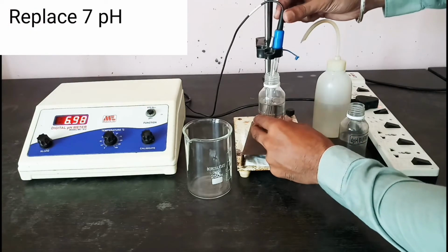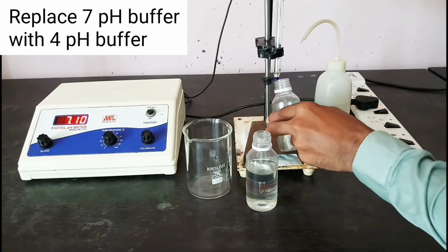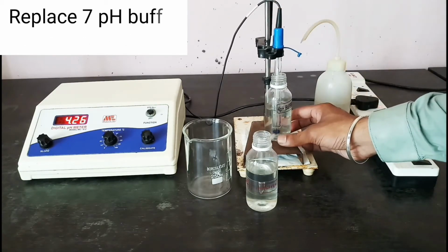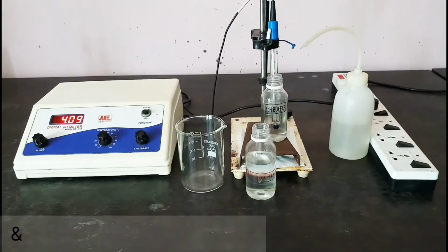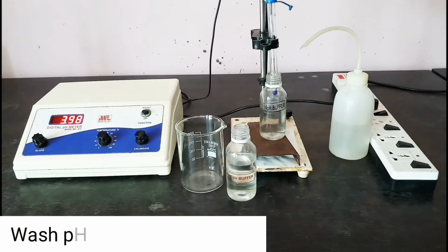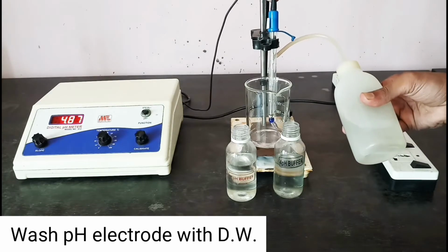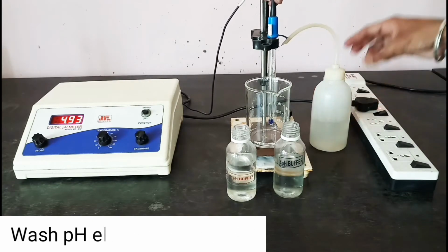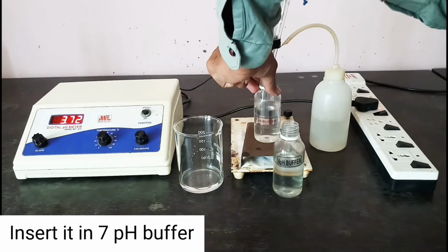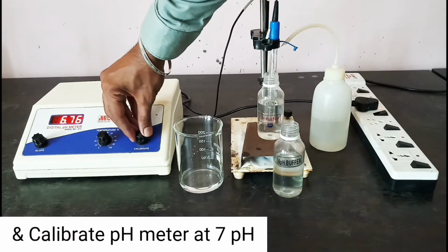Replace the 7 pH buffer with 4 pH buffer, and calibrate the pH meter at 4 pH. Wash the pH electrode with distilled water. Insert it in 7 pH buffer and calibrate the pH meter at 7 pH.